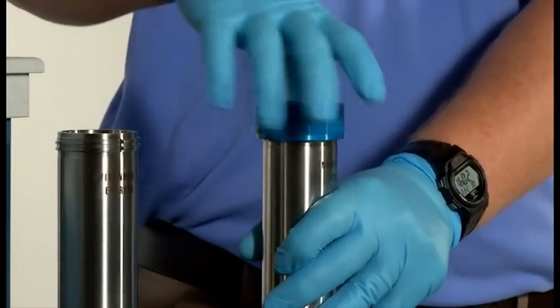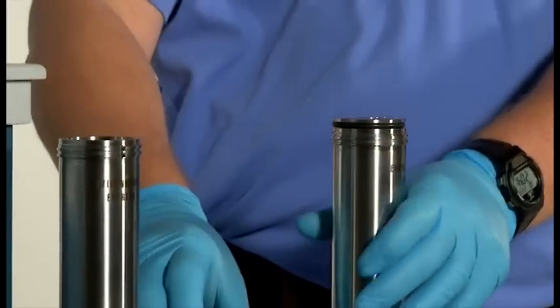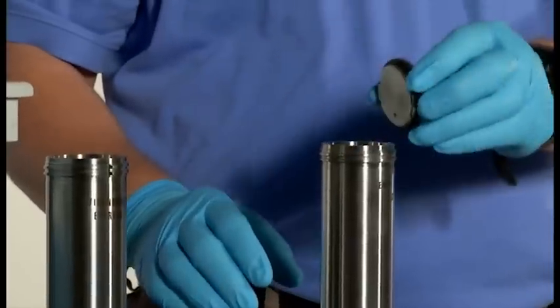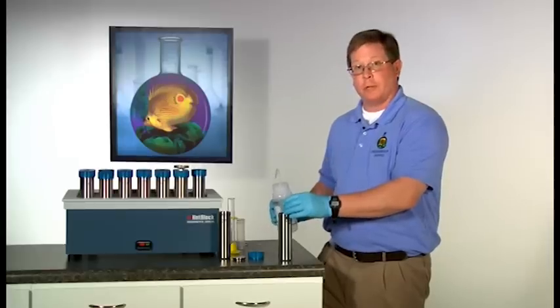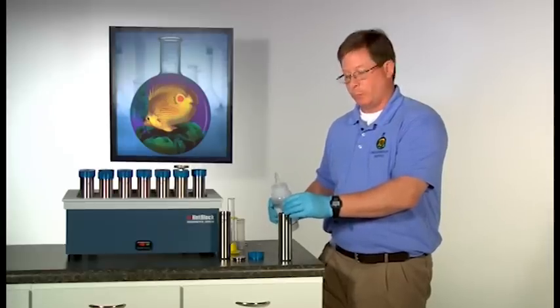unscrew the outer threaded cap and remove the stainless steel inner lid. Rinse the inner lid with the appropriate solvent, taking care to collect the solvent within the cell.